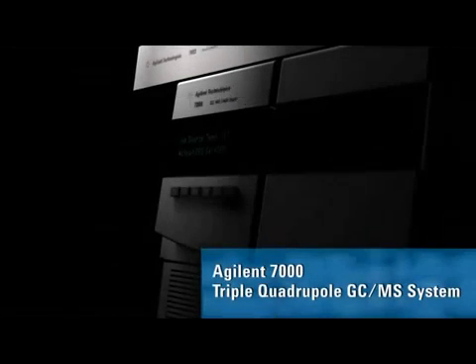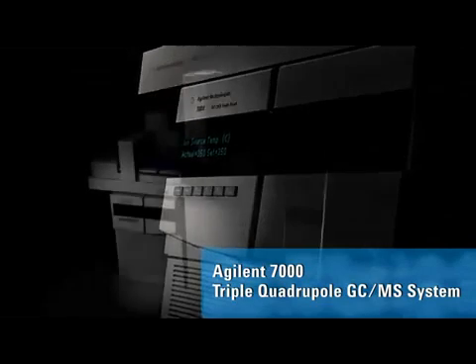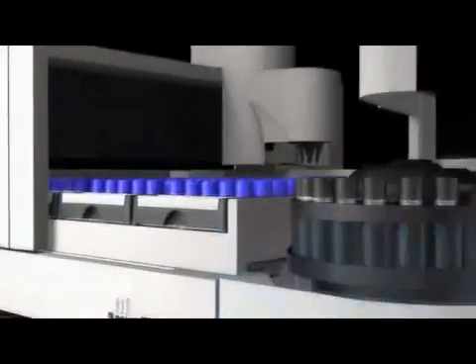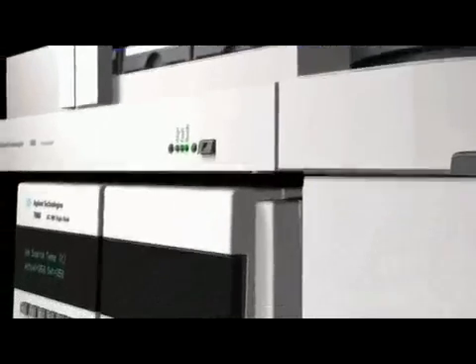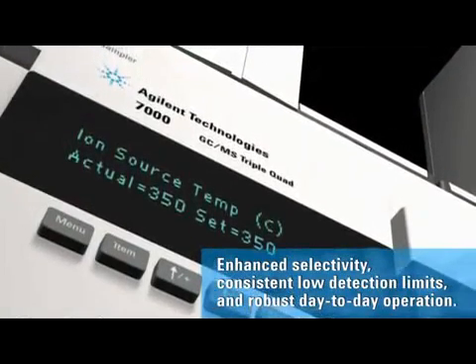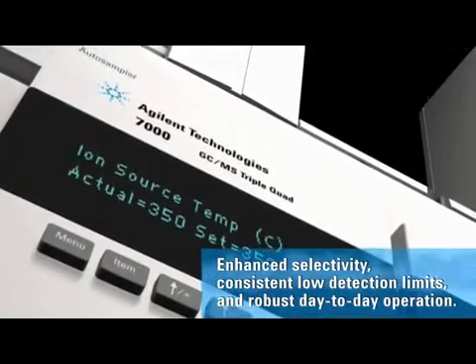The 7000 triple quadrupole GC-MS/MS is the first quadrupole MS/MS system designed specifically for the unique requirements of gas chromatography applications. These requirements include enhanced selectivity, consistent low detection limits, and robust day-to-day operation.